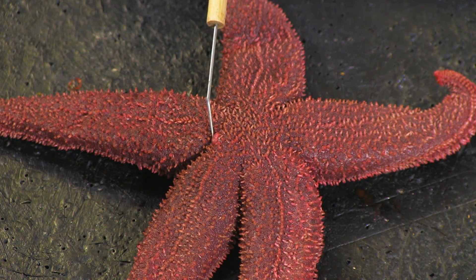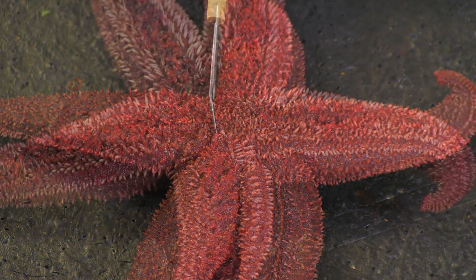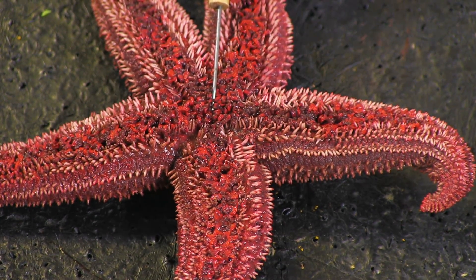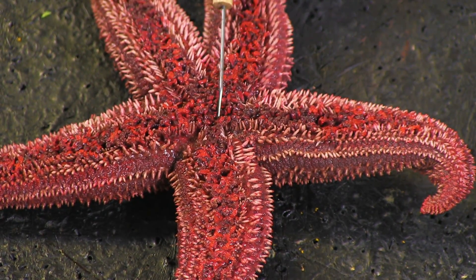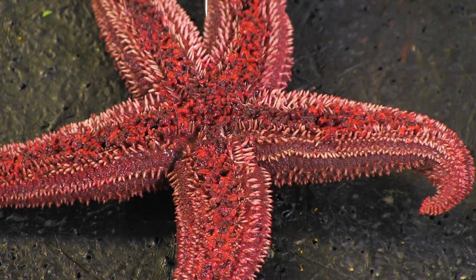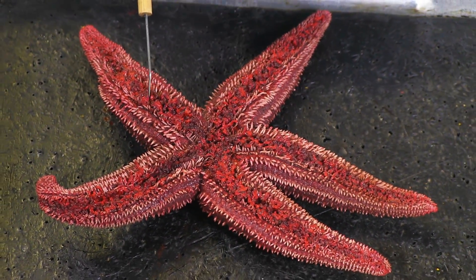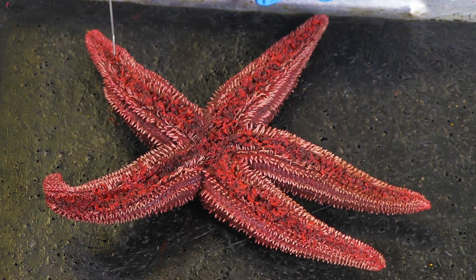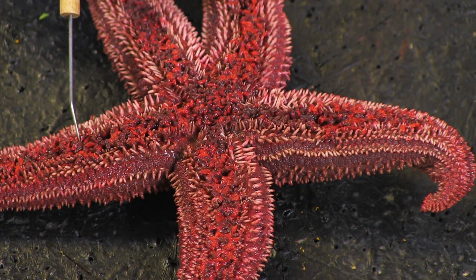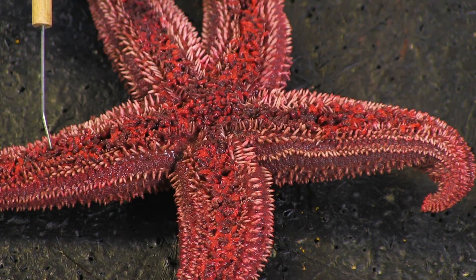The central disc and madriporite are found on the surface of the aboral side. The mouth can be found on the oral side, seen in the middle of the central disc and surrounded by spines. Notice the ambulacral grooves that extend from the mouth to the tip of each arm, and observe the suction cup-like projections known as tube feet which line these grooves.